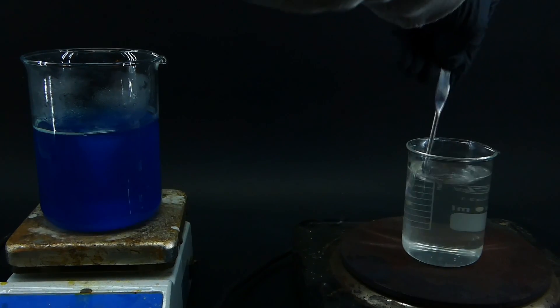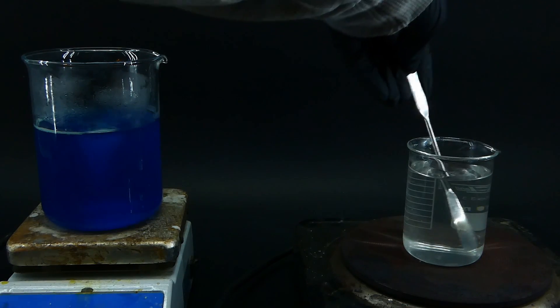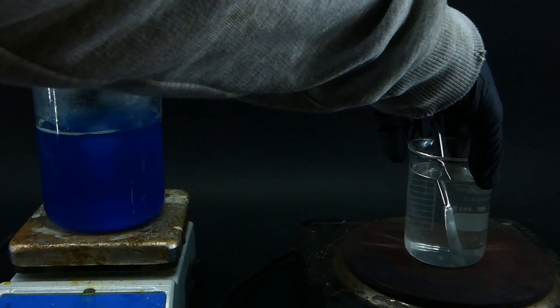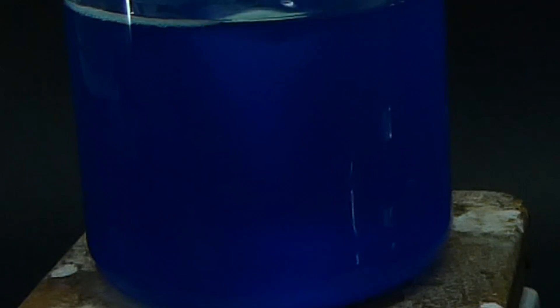After a few minutes of heating, the ingredients dissolved into the water, forming pretty cool solutions. The copper sulfate one was a little cloudy due to some impurities, but this shouldn't be a problem.